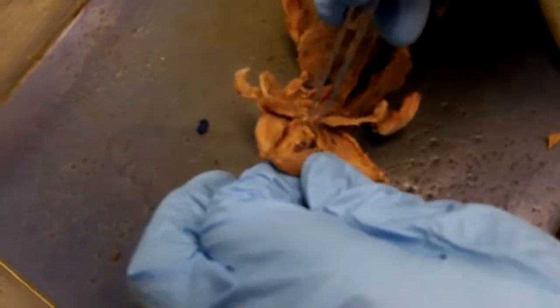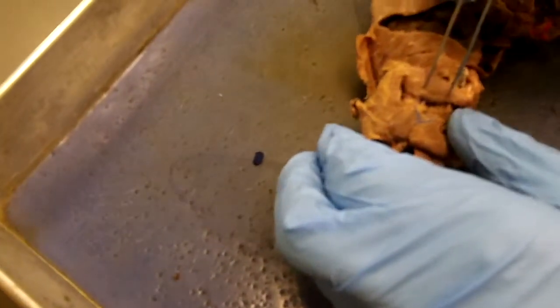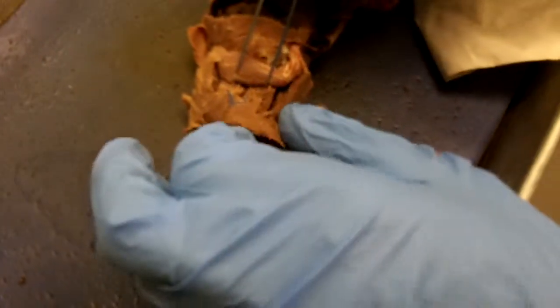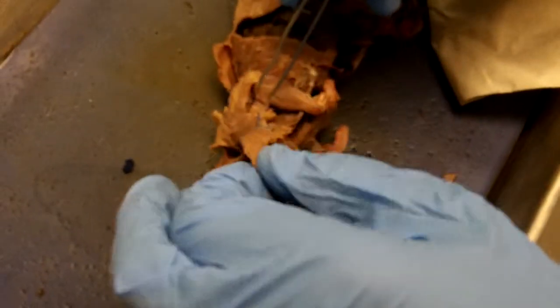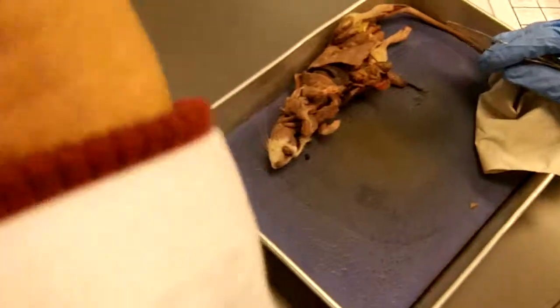This is just really beat up in here. Brachialis. And that's my question. This is not a good specimen for looking at anymore in there.